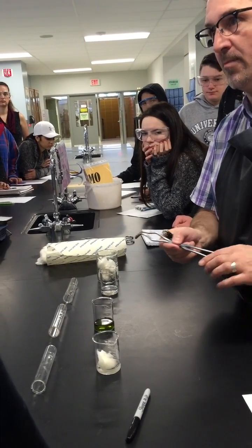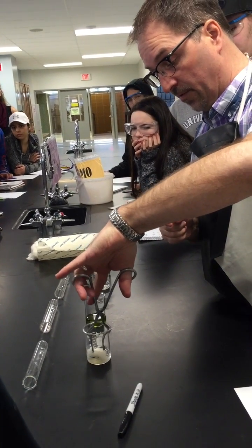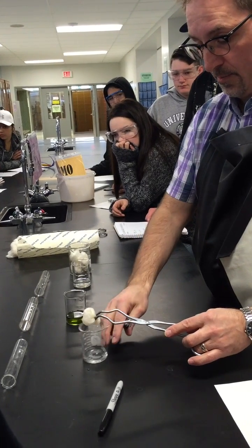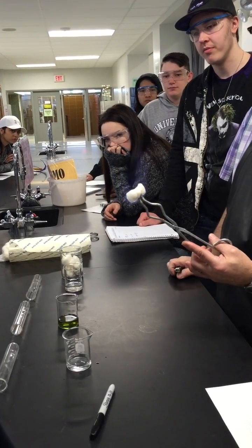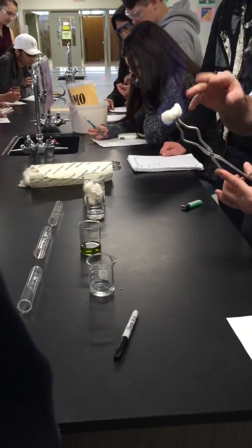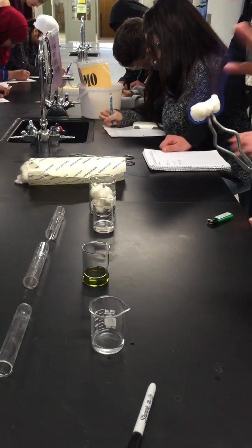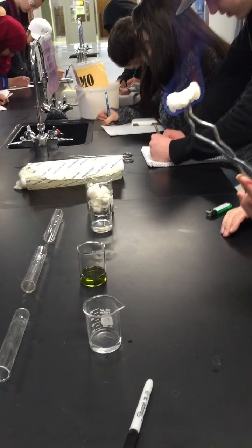So what kind of flame do you think we'll see here? A regular orange flame? You wish. Blue flame. Every so often you'll see a little bit of orange coming up there. You'll see some orange in there because some places there won't be enough oxygen to burn it, or there may be some other impurities that are burning there.